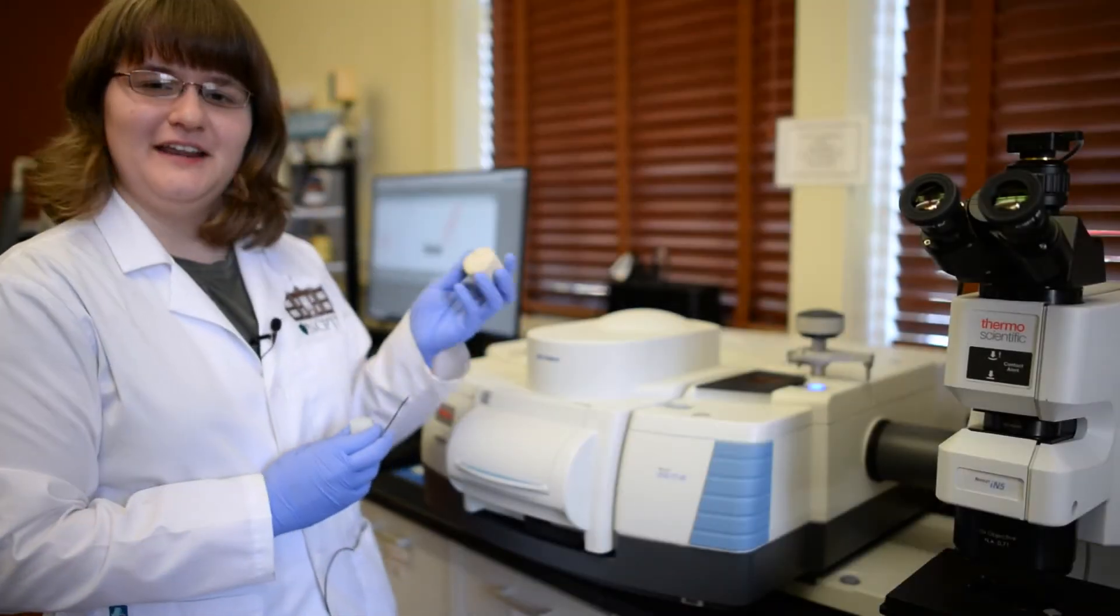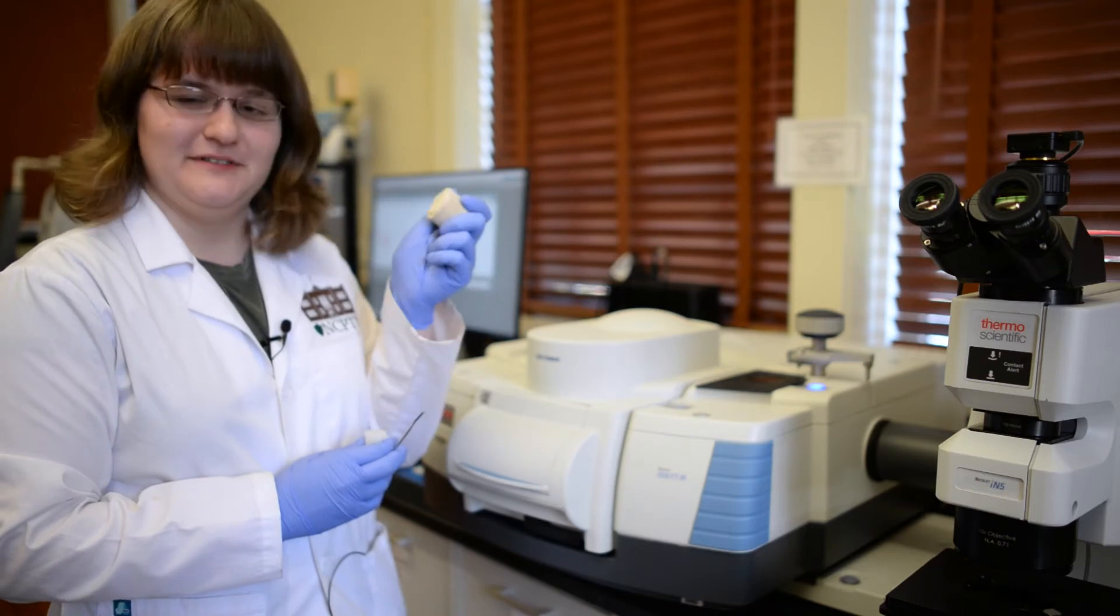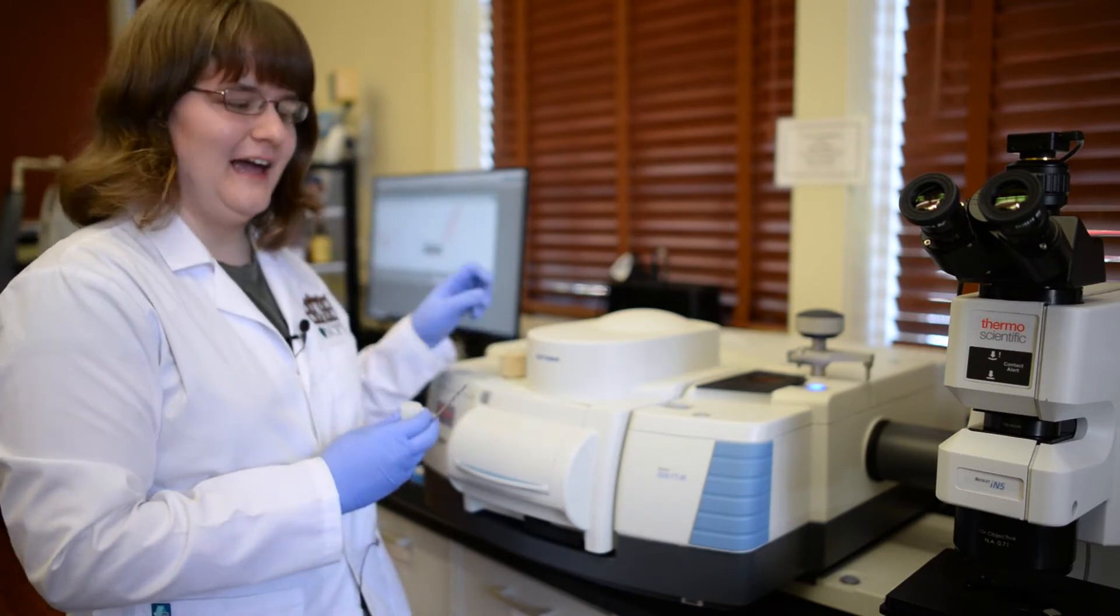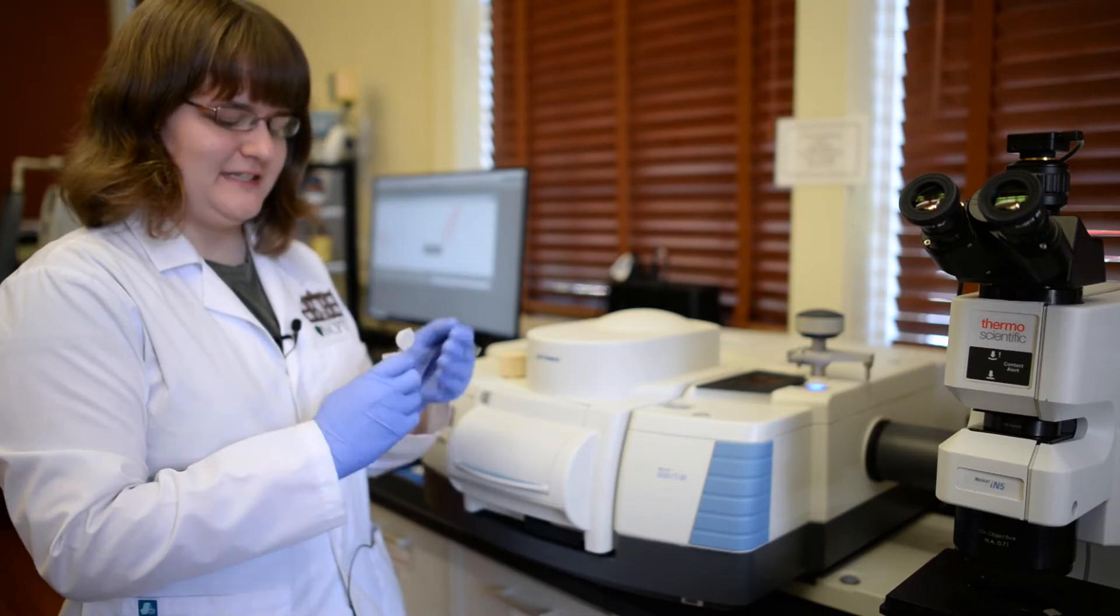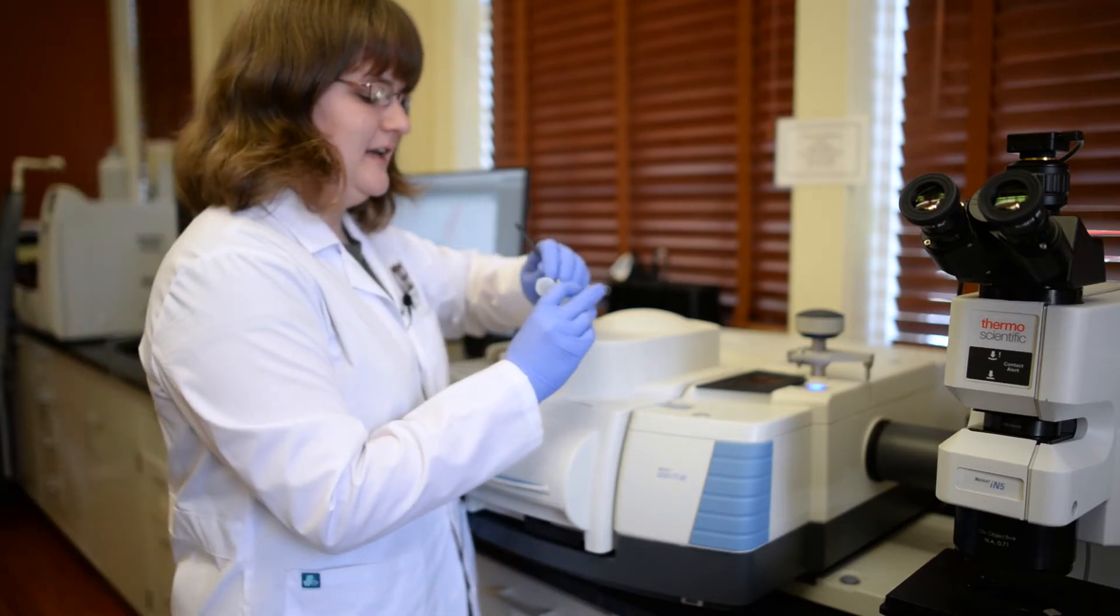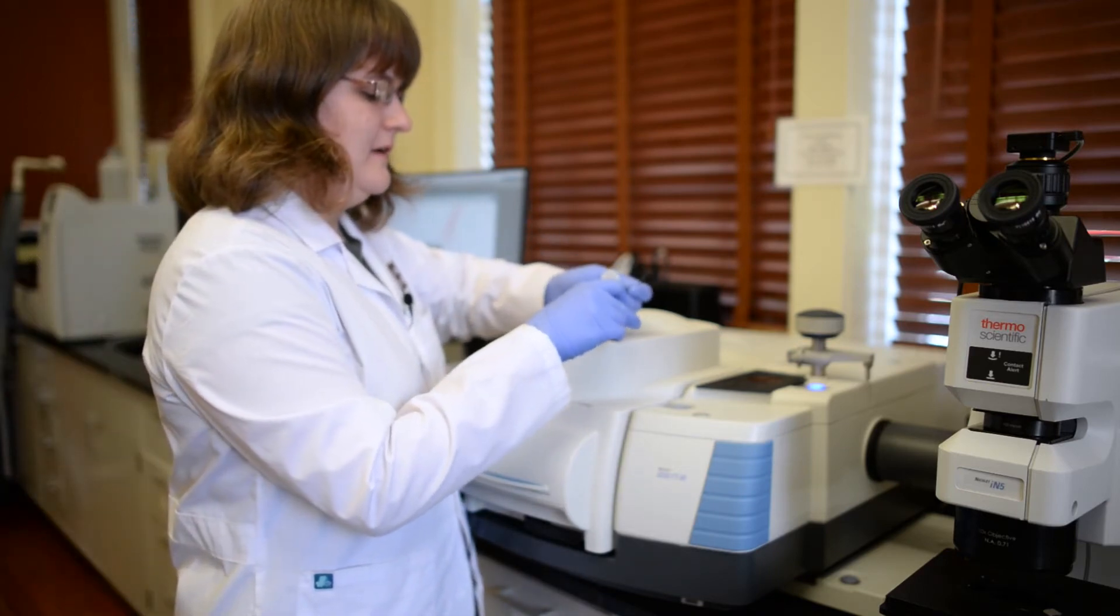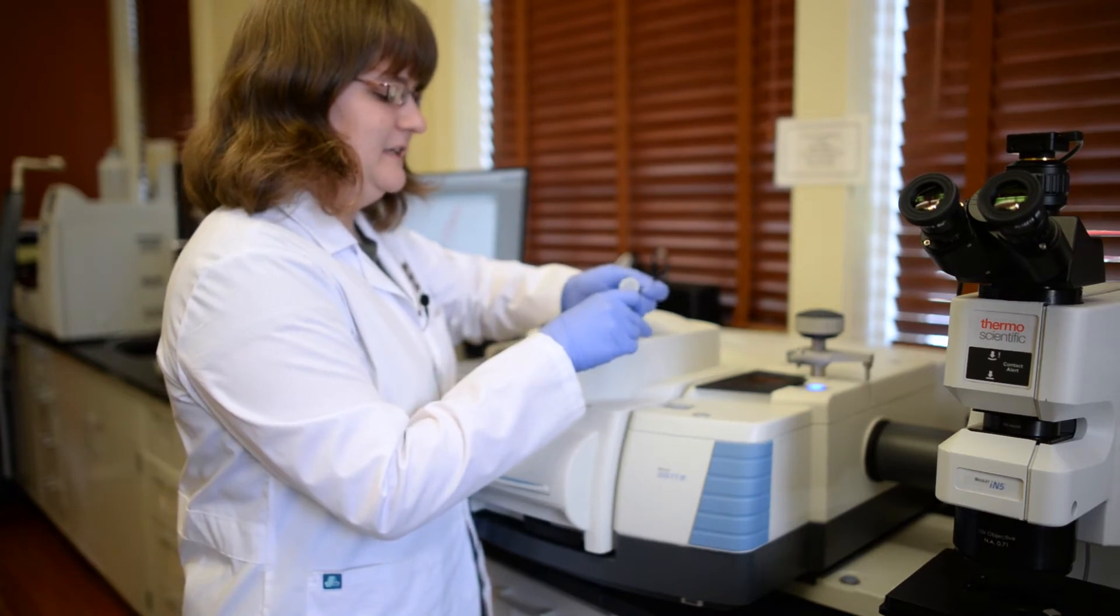I'm going to be showing you how to use the ATR with this limestone sample that I have here. Like I mentioned, when we have a solid like that, we typically powderize it. I've got some powder that I collected earlier in here, and it doesn't really take much.